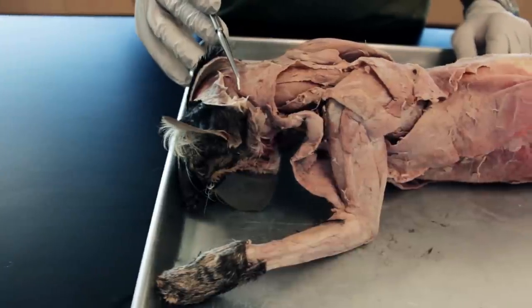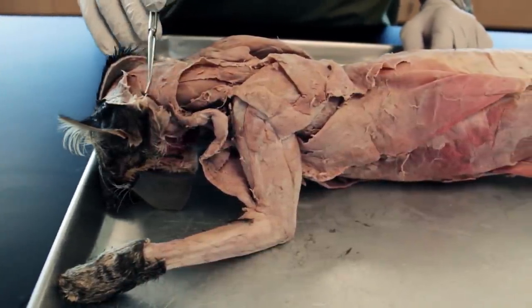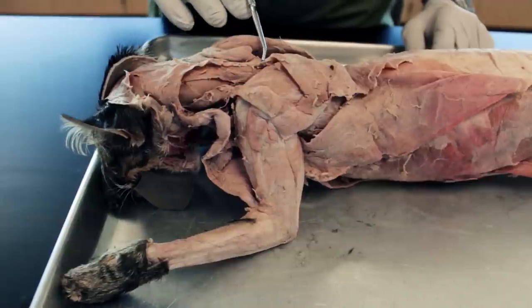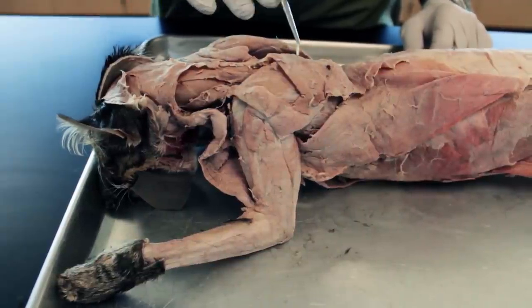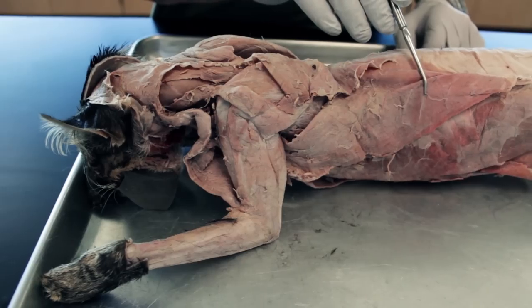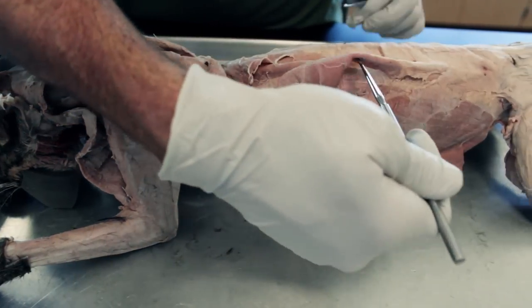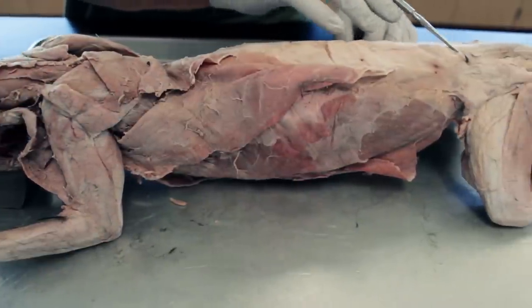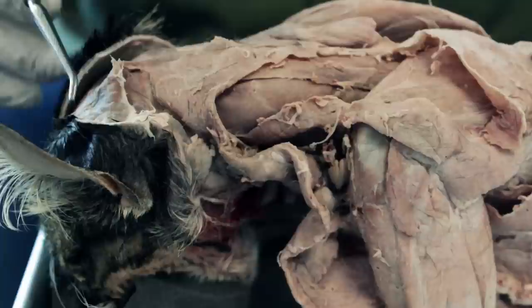We're going to be looking at the superficial muscles of the dorsal part of the cat. We have the neck muscles here, moving over we have the trapezius muscles here. We have down here the most prominent one, the latissimus dorsi. And then we'll be going over the superficial muscles and the deep muscles for the back.